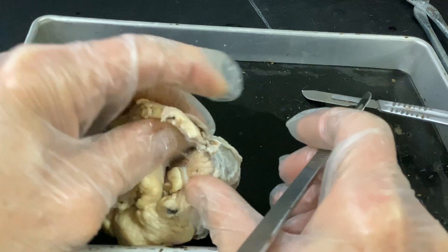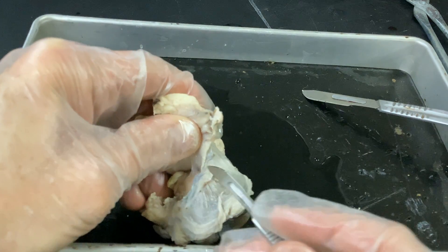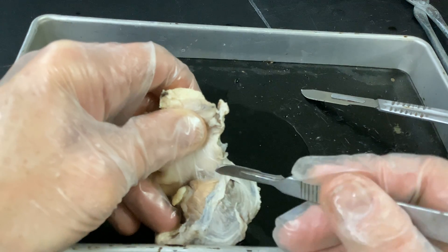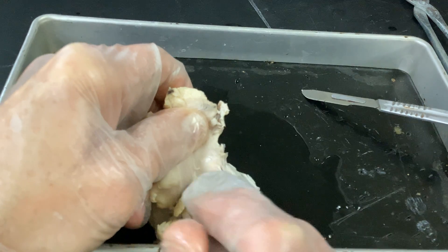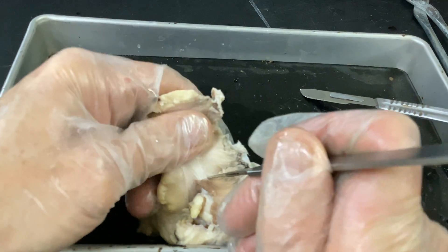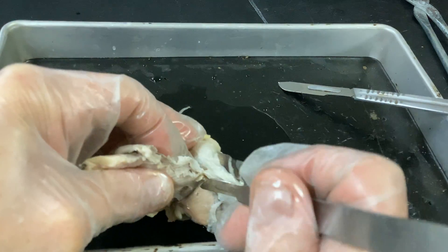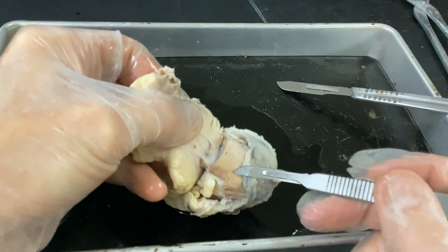I'm cutting the muscle, but remember the muscle is going to be attached to the sclera. And if you look, it's very fibrous, very durable. There's some of that fibrous connective tissue — see how wispy that is, very cotton-like. I'm just going to go in and methodically try not to hack myself up here. If you look, that is definitely muscle tissue. You can see the fibers in there.